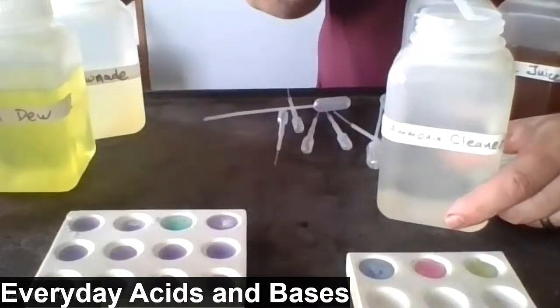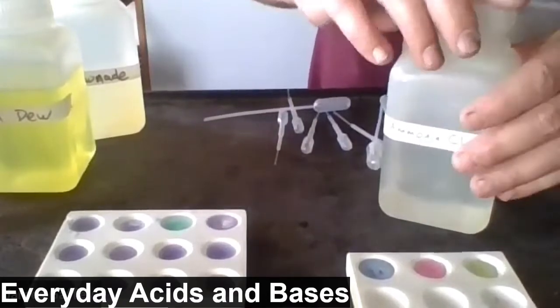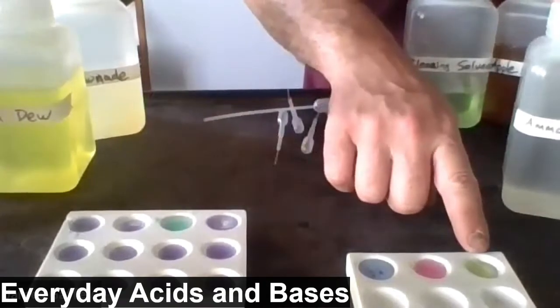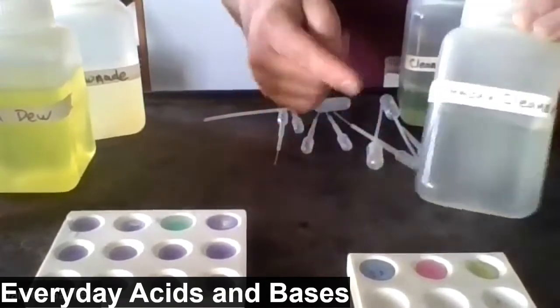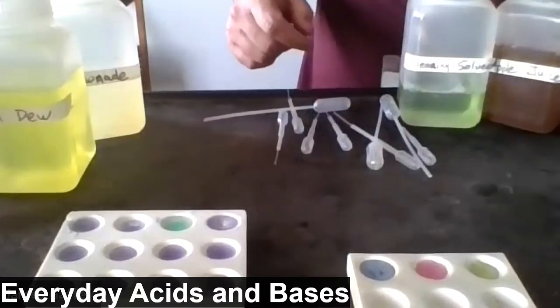Do you notice the greenish bluish color? This color matches what we saw with sodium hydroxide, a known base. That would lead us to believe that perhaps ammonia cleaner is basic.